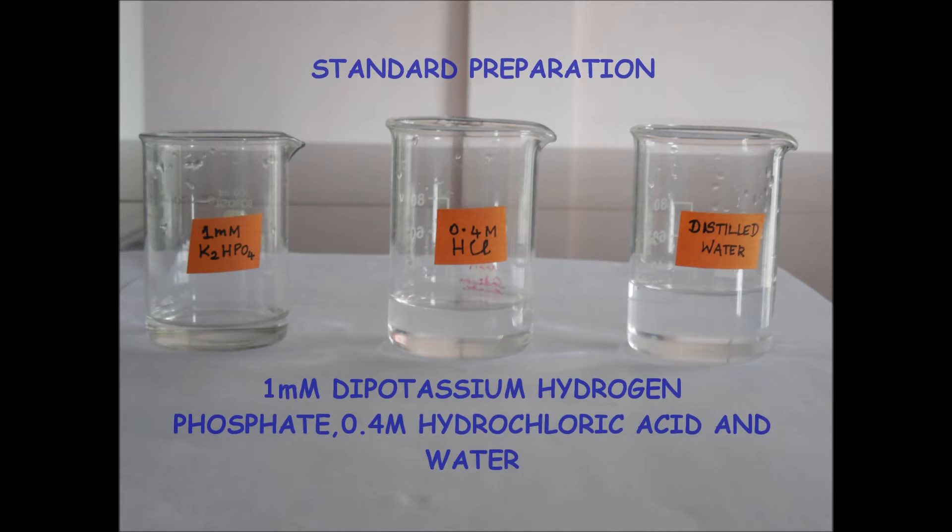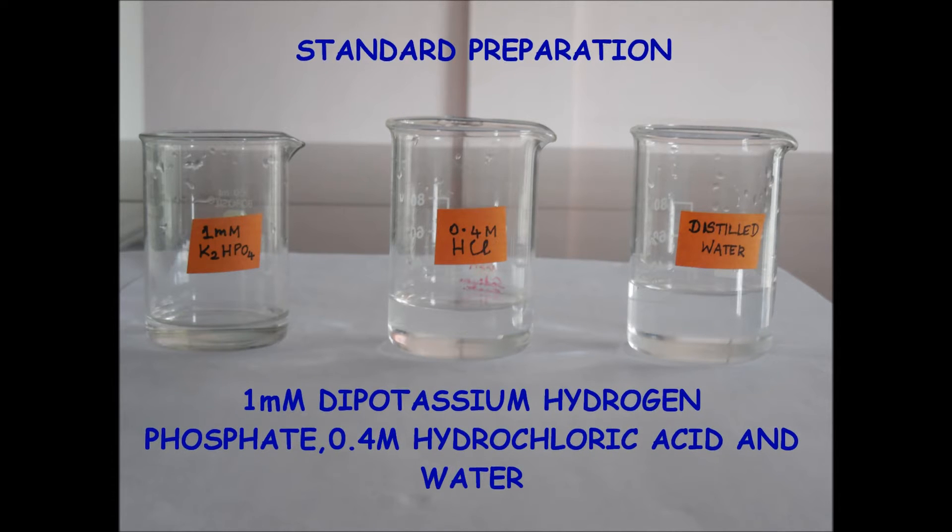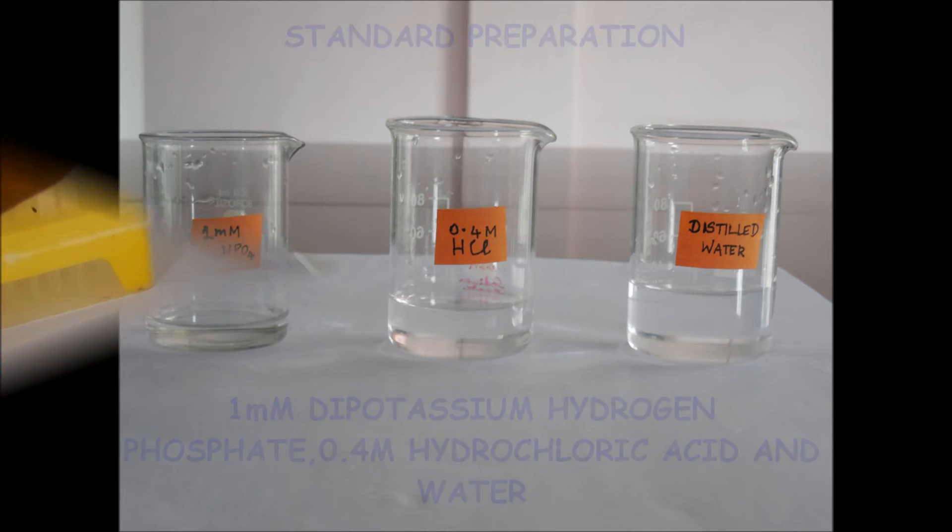For standards, the reagents required are dipotassium hydrogen phosphate, 0.4 molar hydrochloric acid, and distilled water.